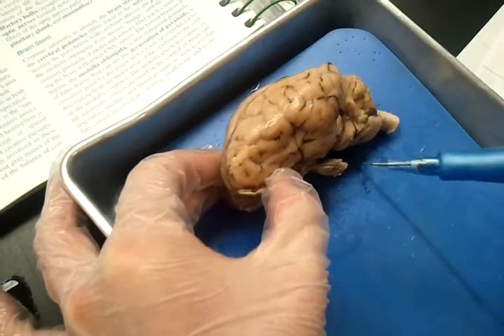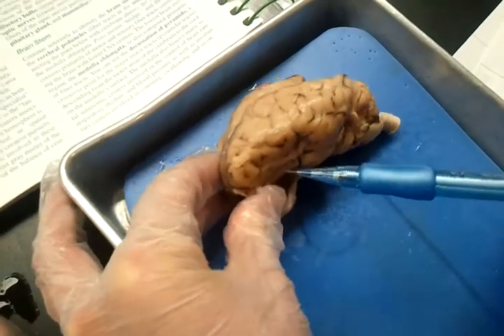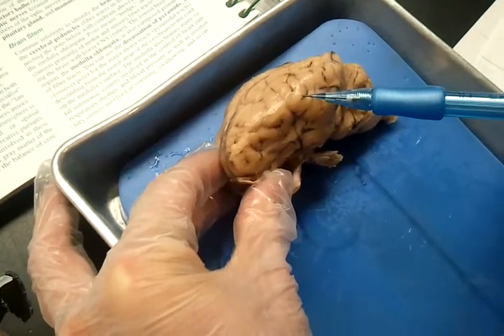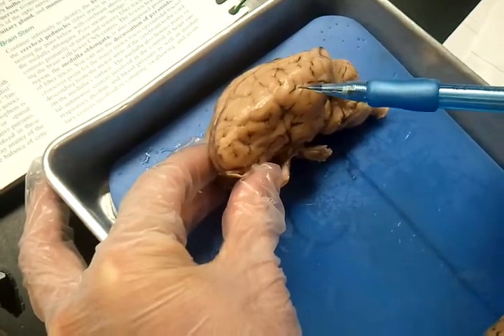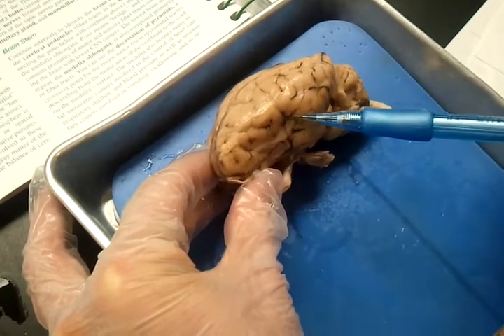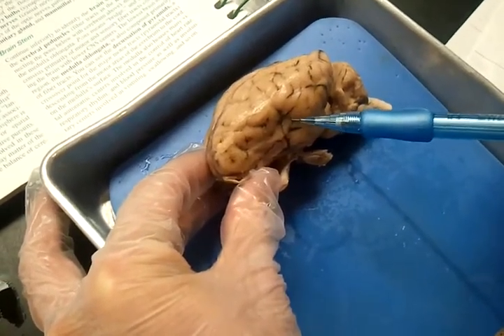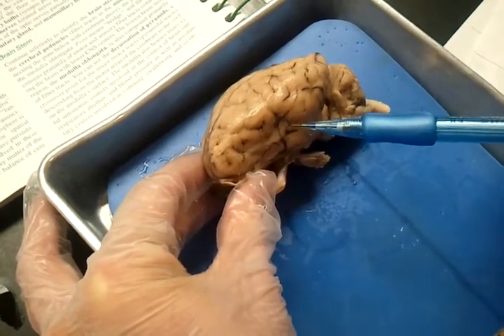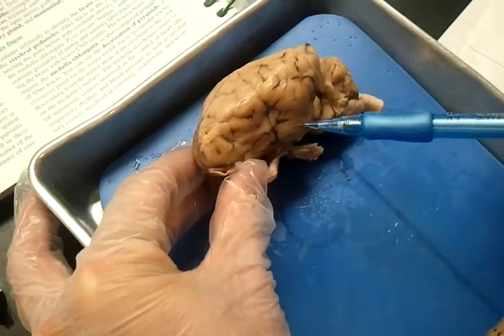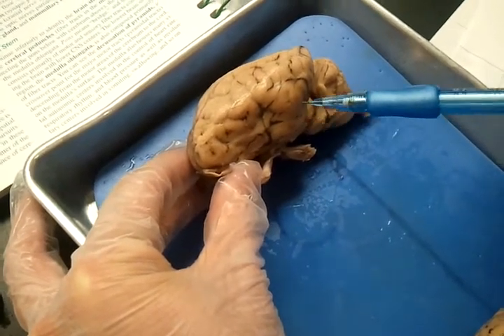And coming down to the prefrontal cortex at the bottom, we have this area right here, which works for memory and tasks that you do. And we also have this area right below it that is the executive area for a task. And then a little bit farther down, we have Broca's area, which is right in this area.